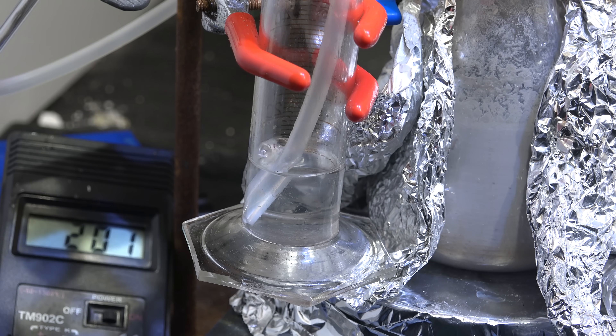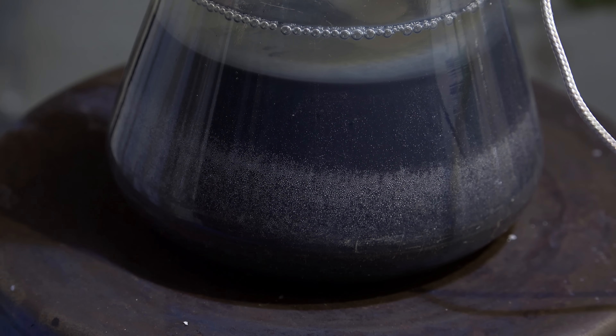I've been running a concurrent sodium experiment where I ran with an excess stoichiometric ratio of sodium hydroxide to magnesium. I already ran this test a while back to see if we could avoid using dioxane by making sodium without magnesium contamination. We found it was very difficult to finish since the reaction kept getting slower and slower and even after three days it never finished. I decided to revisit that experiment with more time, and this time I used huge amounts of sodium hydroxide — almost twice as much — and ran for several days. Finally the reaction flipped over and all the magnesium was consumed, but something interesting happened: the sodium broke up into a very fine dispersion. You can see it here almost like sand.